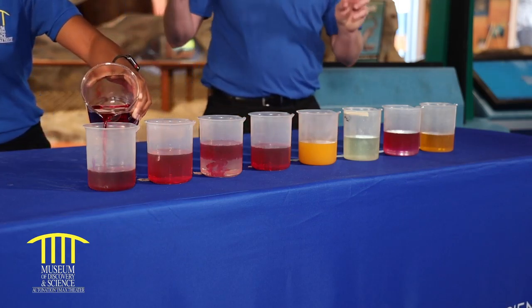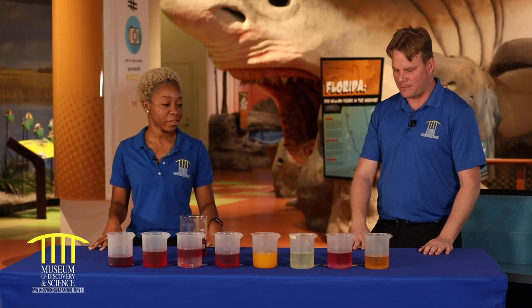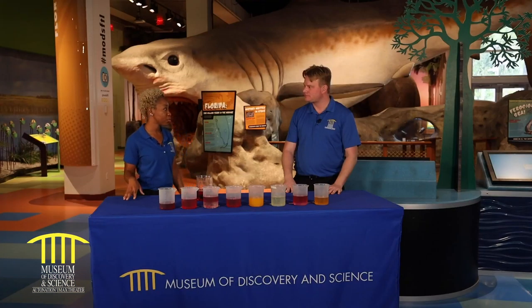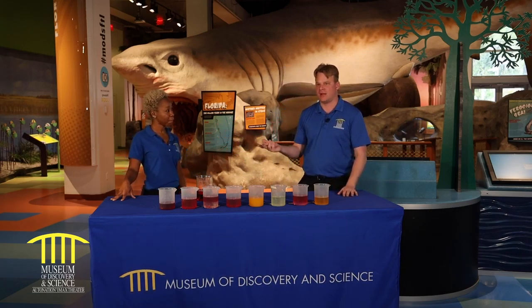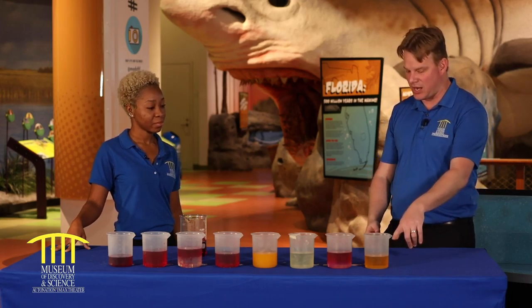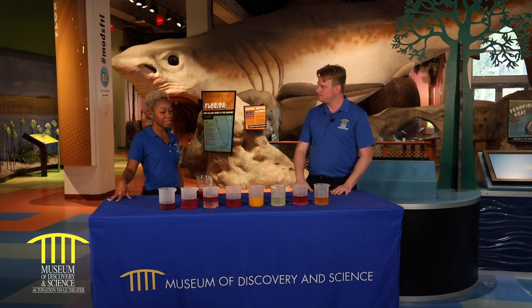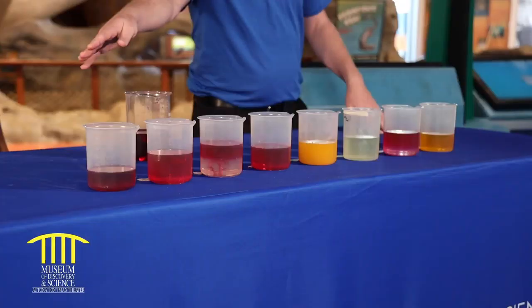So this is an indicator — it's indicating something. What is it indicating? This test is indicating where things are acids or bases. Acid — like I pour acid in my pool, or are there acids I can put in my body? Yes, there are some acids you can consume and some you want to stay away from. A good example of one you might consume is vinegar, which you'd have on a salad. Vinegar is an acid, and that's why it turned yellow. So if I pour this indicator into an acid, it's going to turn yellow-orange. And if it's a base, it will remain red. So all of these that are still red are bases — correct.